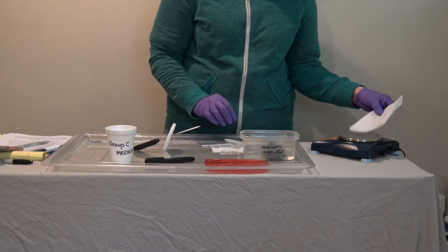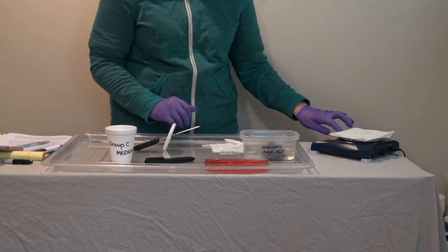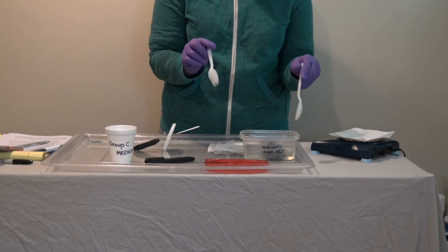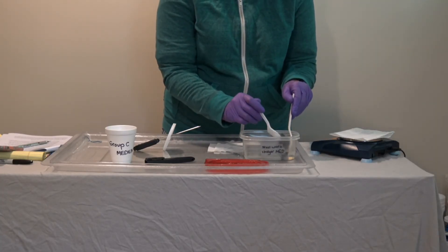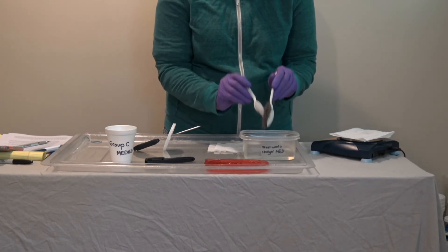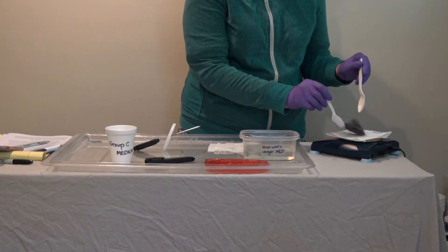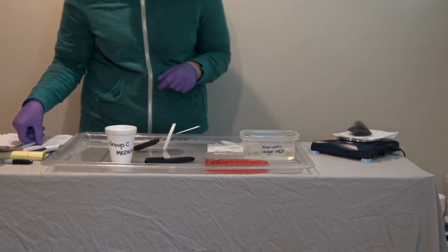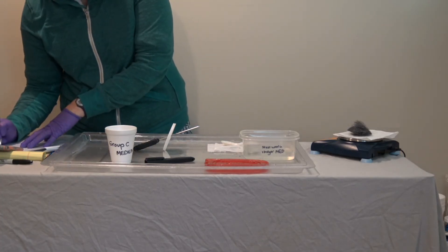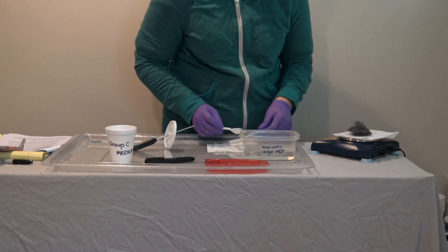Next, make sure to place a piece of paper towel on top of a scale and zero the scale. Use a couple of plastic spoons to pull a medium-sized piece of steel wool out of the vinegar, gently and quickly give it a shake to get excess vinegar dripping off, place it on the paper towel, and record the weight. About 6.27 grams — there is still some vinegar in there, but that's negligible.